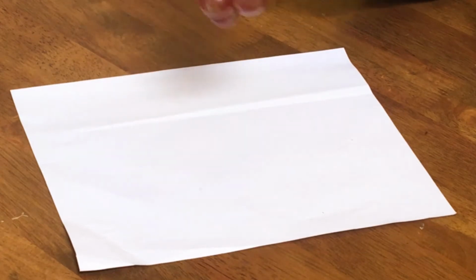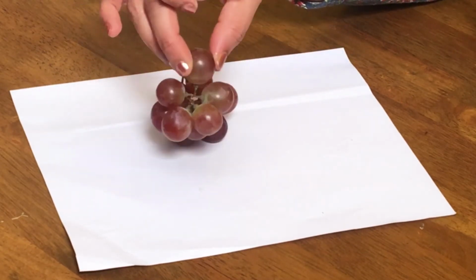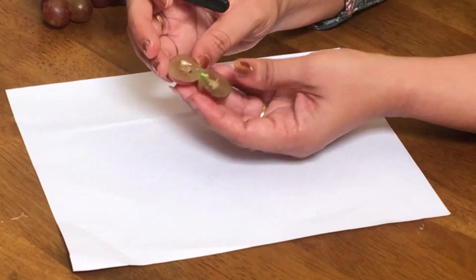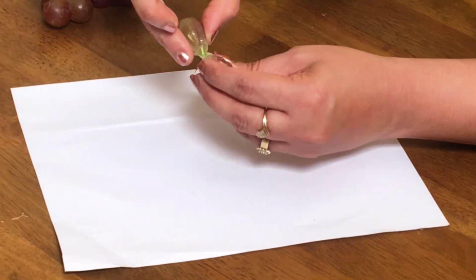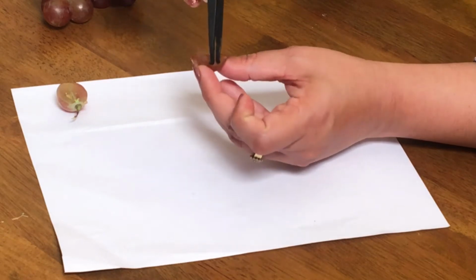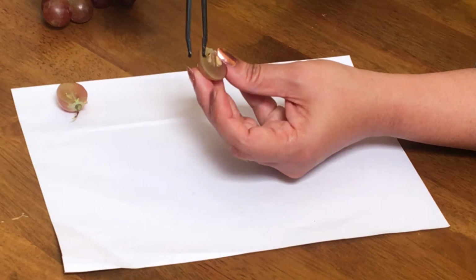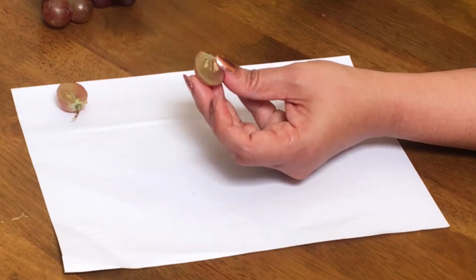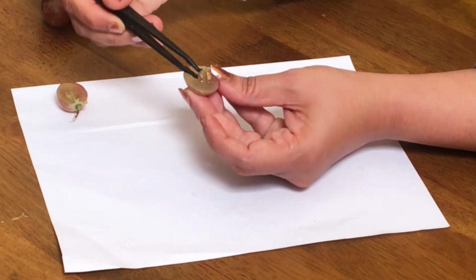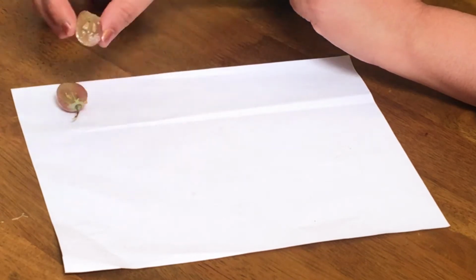So this is actually an inflorescence where there were many flowers, and each flower had an ovary and they developed into a fruit. So if you cut open the grapes, you can see them like this. This is the pericarp, which has an outer leathery part called the epicarp. This is the soft and fleshy mesocarp and an endocarp inside, and here you can find the seeds. These are the seeds. And grape is called a berry fruit.